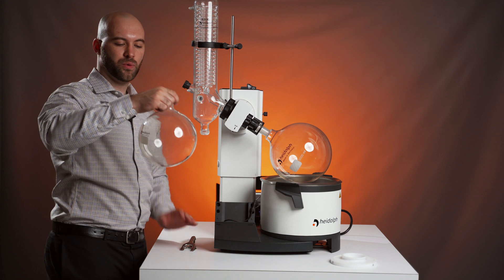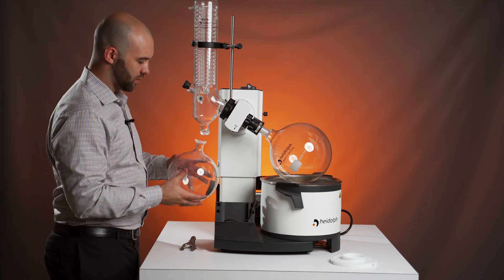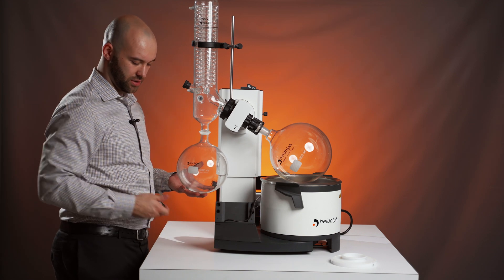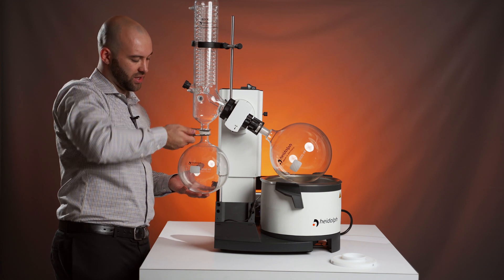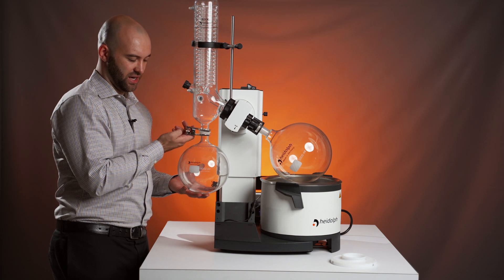Following that, you can attach our three-liter flask. Connects to this ball joint with a clamp that you can tighten so it will not open.